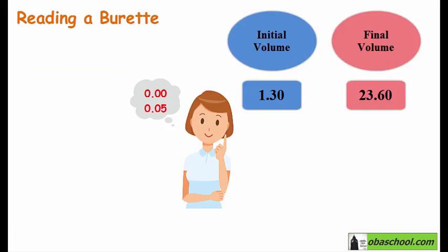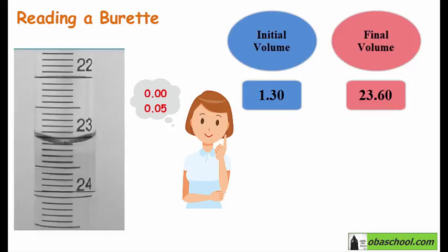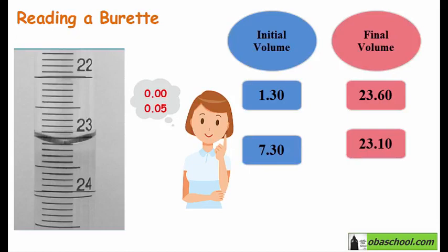Now we will run the titration and we have to take the final reading. So again, record the final reading. Always remember to record your reading to 2 decimal places, where the second one should be 0 or 5. So these are the correct readings.